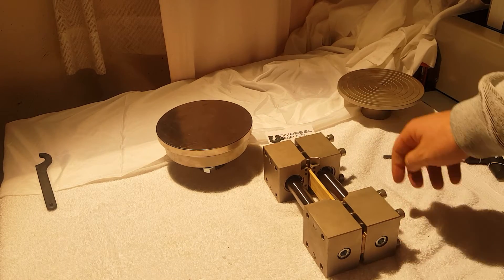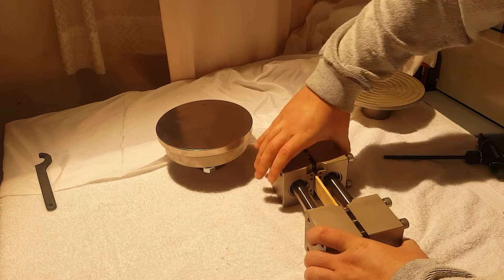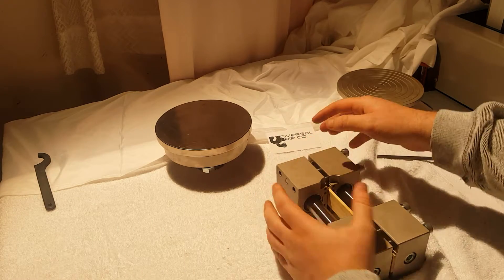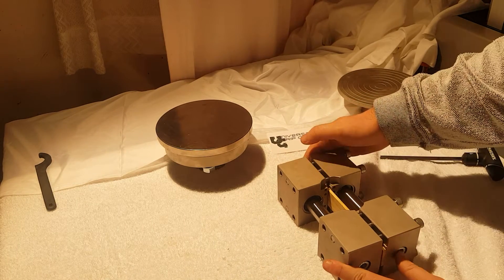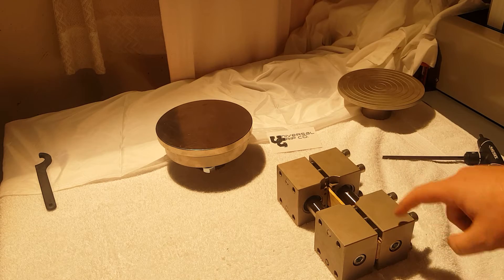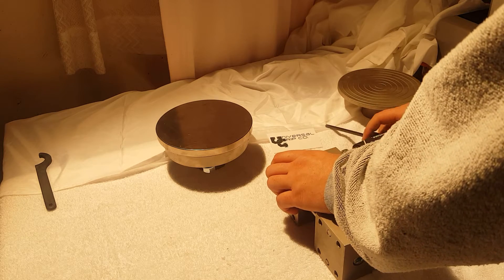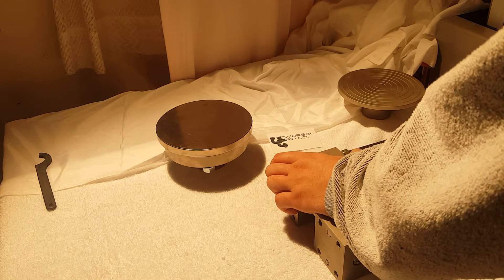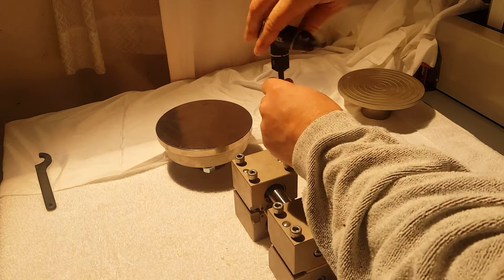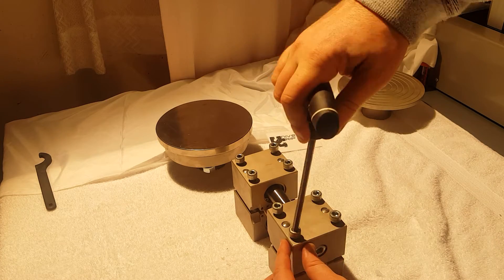You can see it's flush there on the bottom as well as on the top. Now it's flush on both the bottom and the top, so we can start tightening the screws. We'll go ahead and tighten the screws using that same sort of alternating pattern, making sure everything is tight.